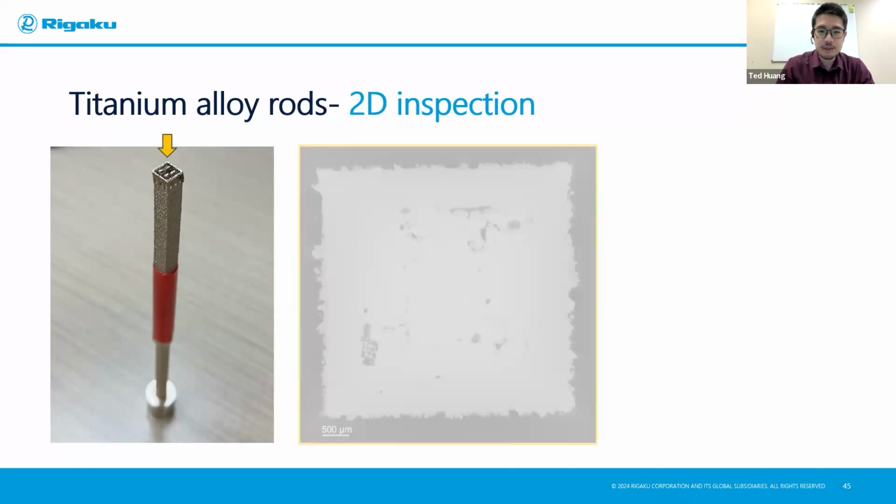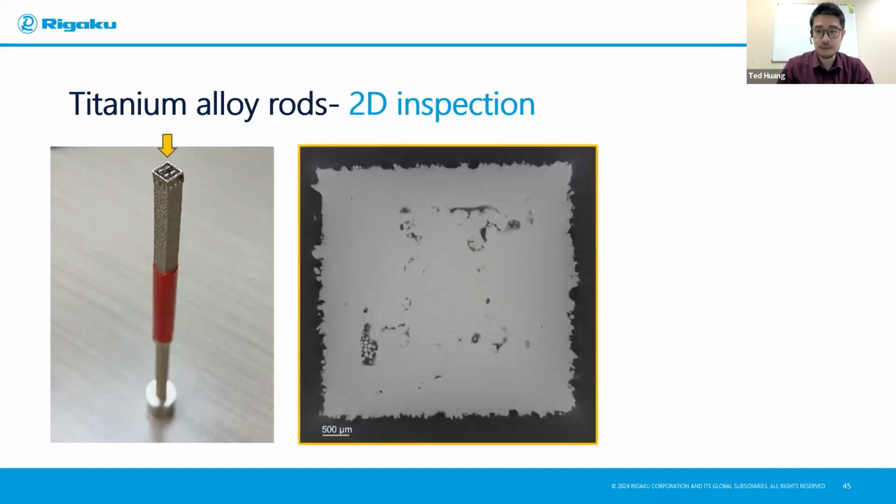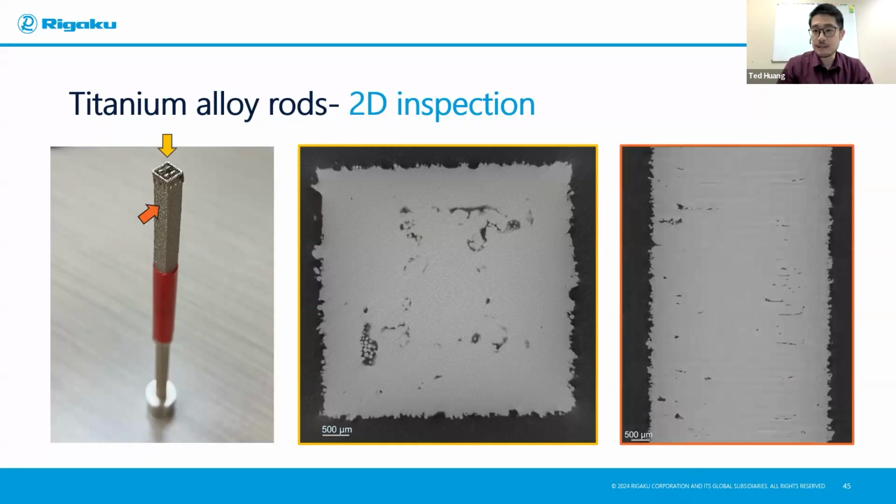So if we look from the top, this is the cross-section that we're seeing from the 3D data. You can already see some vacancies or gaps in there, and there are some powders probably not sintered together well and trapped inside there. And from the side, you can see very clearly a layer that tells you what's the printing direction that it has gone through.